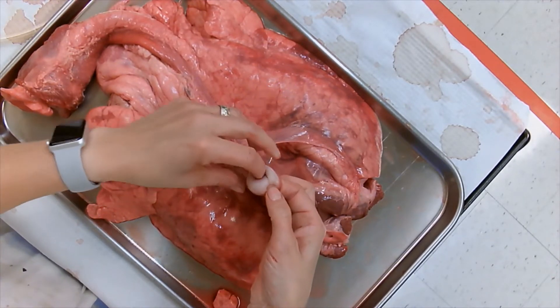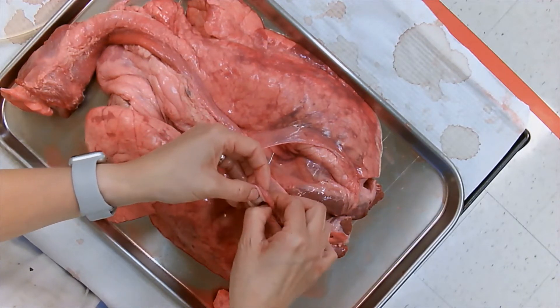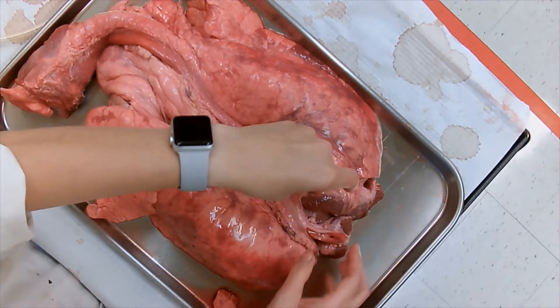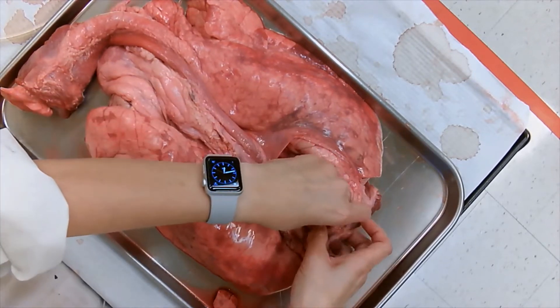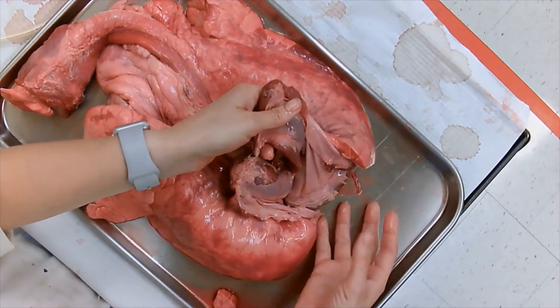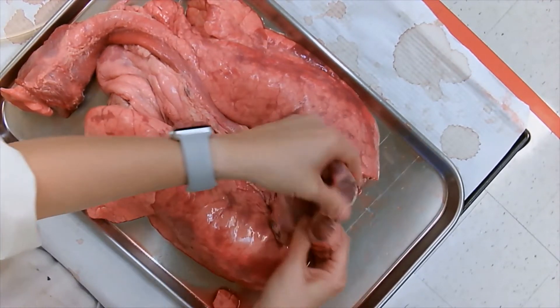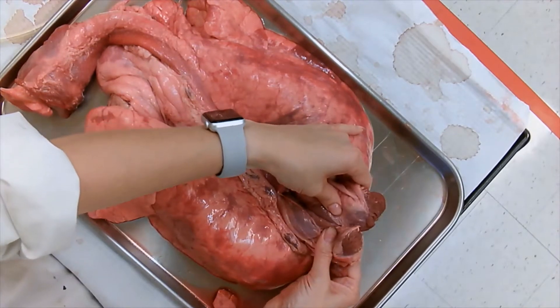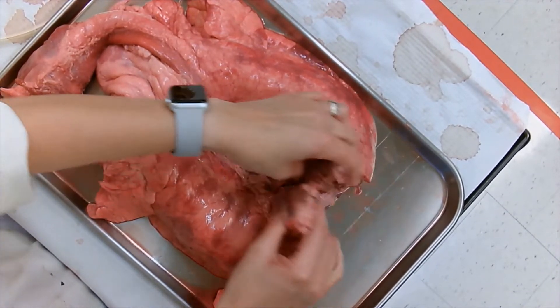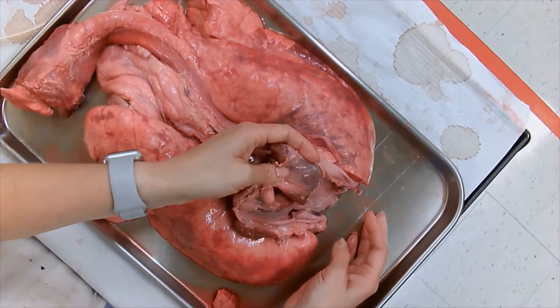So what do you think that opening drops into? Exactly — this is the esophagus, it goes down here, and then there's this opening right here where you would have your stomach on the other side. This here is a big giant muscle.